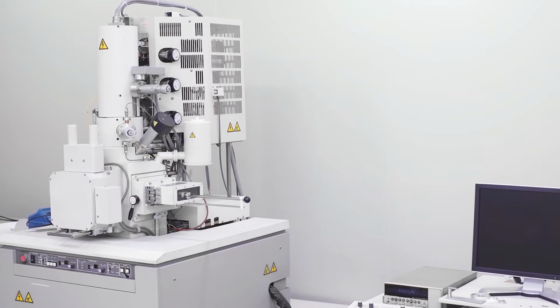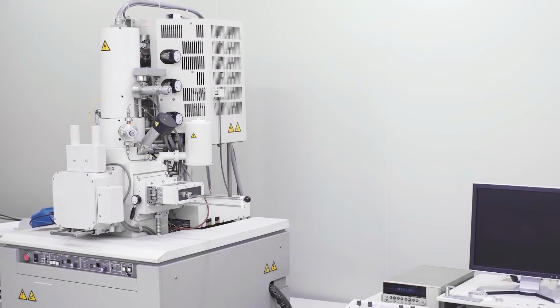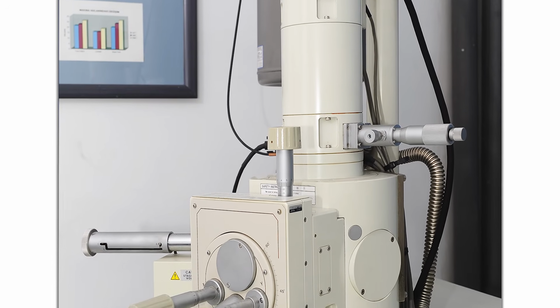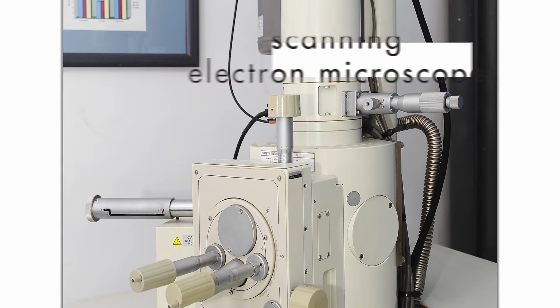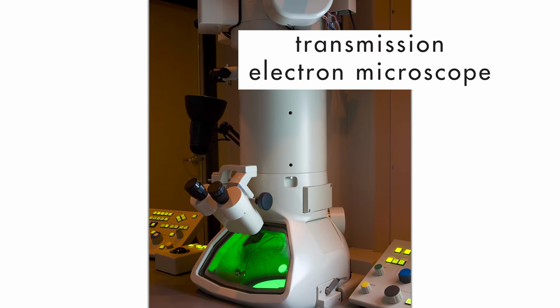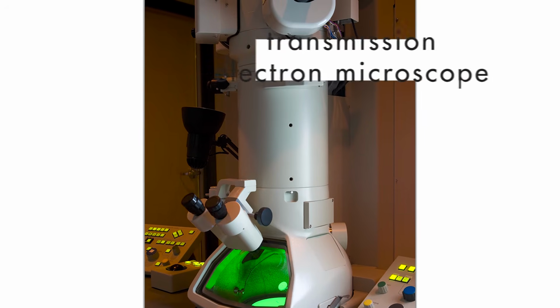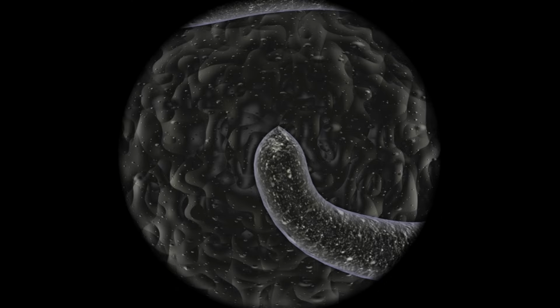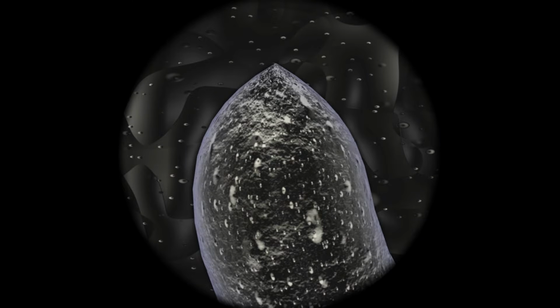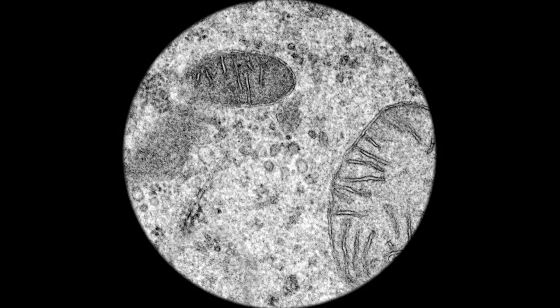Some non-optical microscopes use beams of electrons to magnify images. These are called electron microscopes. Two common electron microscopes are scanning electron microscopes and transmission electron microscopes. A scanning electron microscope bounces a beam of electrons off a specimen to scan its surface. A transmission electron microscope transmits a beam of electrons through a specimen to see its interior features.